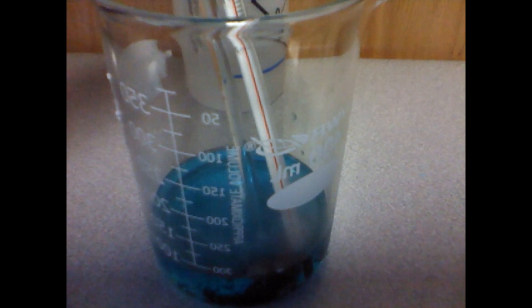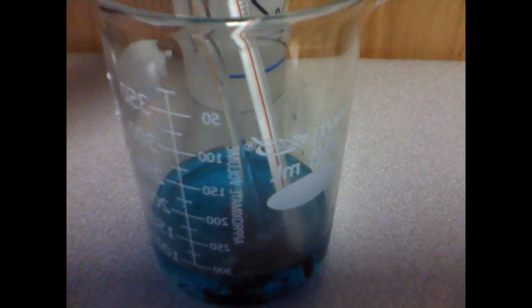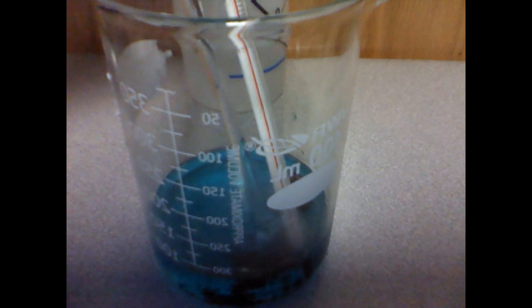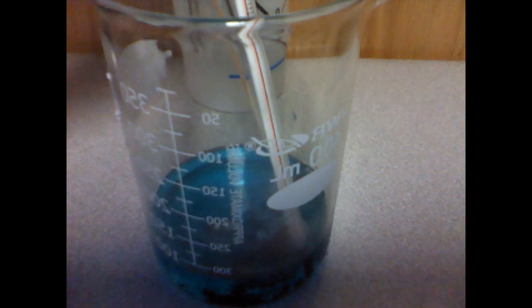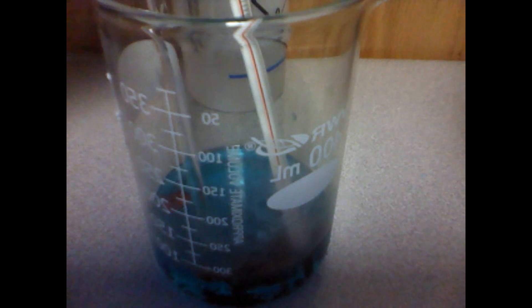As you can see, the foil is starting to bubble. The foil is almost halfway there to completely disintegrating into the copper chloride solution.